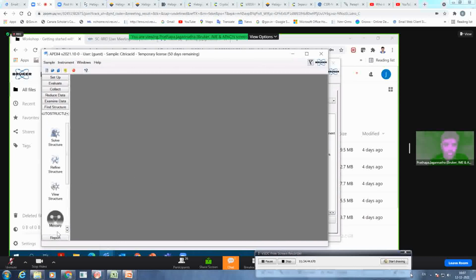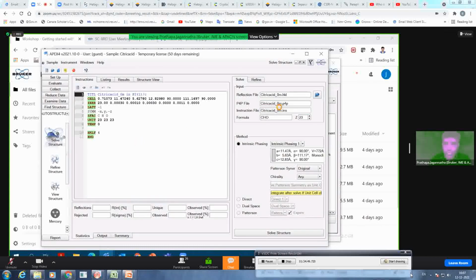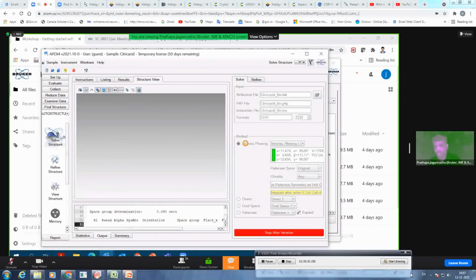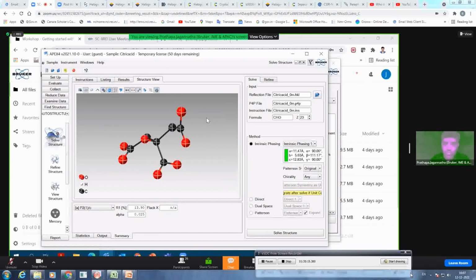Now let's go quickly into the find structure, solve structure option. Where you want to solve your structure, you just basically need the HKL file which you have created after scaling or after determining space group. So you get an HKL file, you use that, and then we have several methods to solve the structure. One is intrinsic phasing, direct methods, dual space, and Patterson. You can use either of those methods, but 95% of the time intrinsic phasing works better. And even for reasonable quality data, you get the atoms rightly assigned as well. Which makes our life much easier.